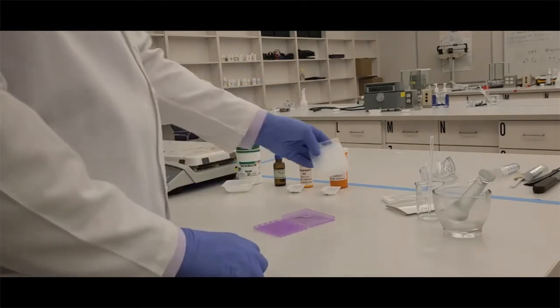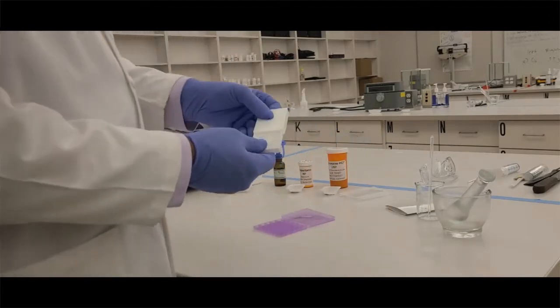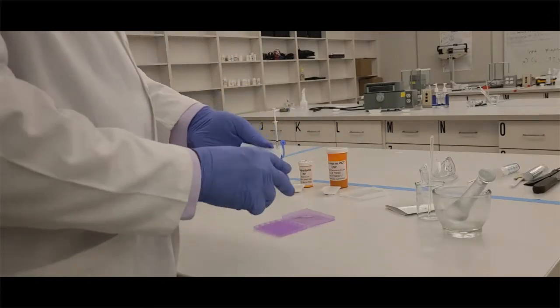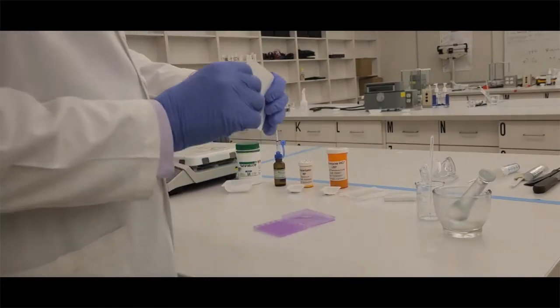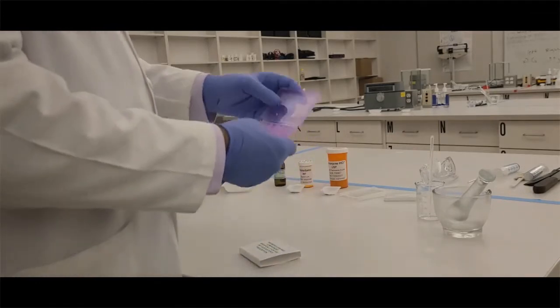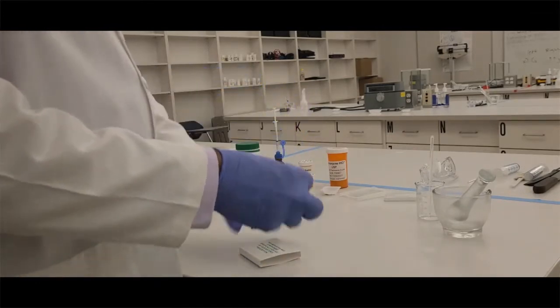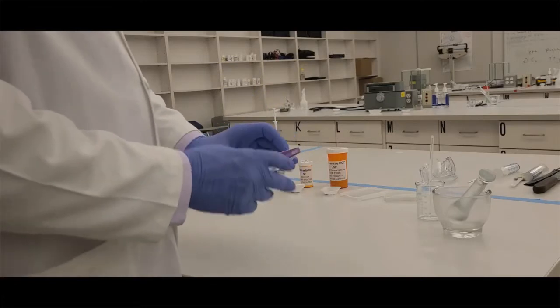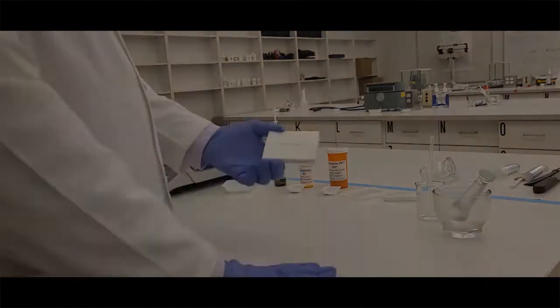This one has a sliding cover that you can see, but it's the same format, five by six, and there's smaller ones that have different compartments in them. For dispensing the troches, you can label the actual plastic or some of these will have a little sleeve that will go in them and you actually label the top of the sleeve.